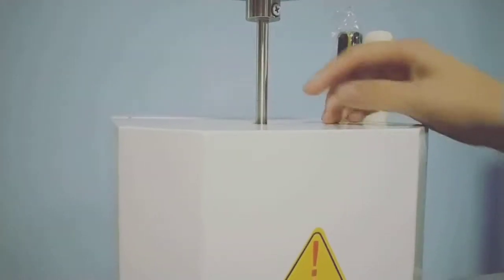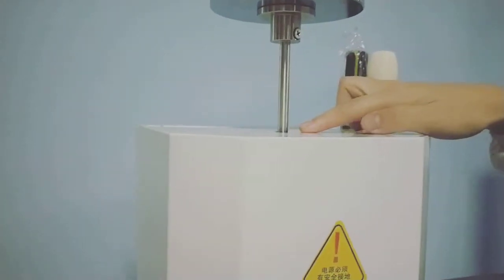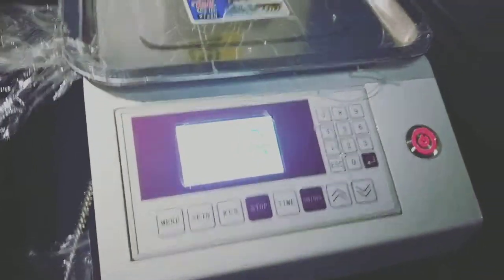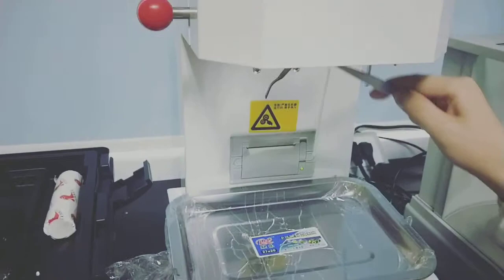Then we do not wait. When the curve is equal to this space, then we press run key. It will automatically cut. And this piece we do not use.